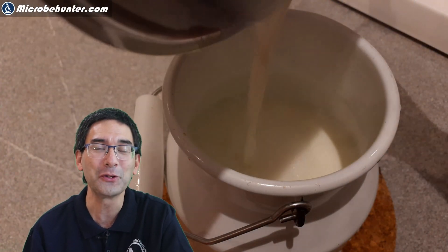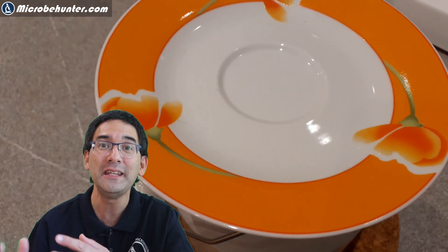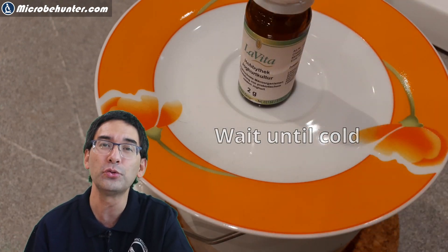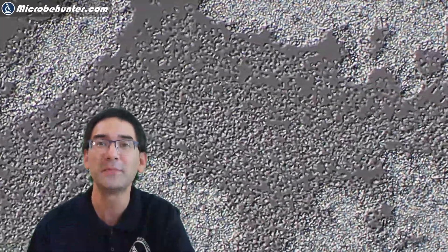Of course, I want to make some yogurt as well, so it's a little bit like I'm doing some cooking here. I heated up the milk, I boiled it, and then I let it cool down. It's really important because you do not want to add those bacteria to hot milk — otherwise you're going to kill them off. I'm going to show you some more of the original bacteria in powder form that I suspended in some water. The clumps that you see are because some of the bacteria have not been fully re-suspended yet.